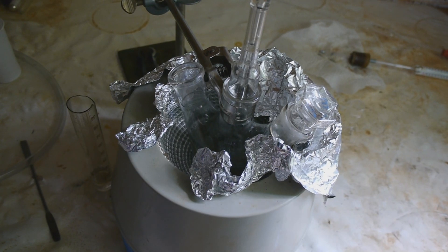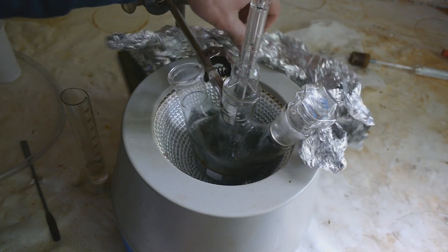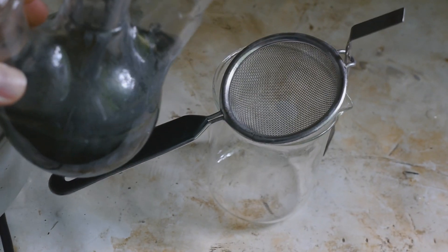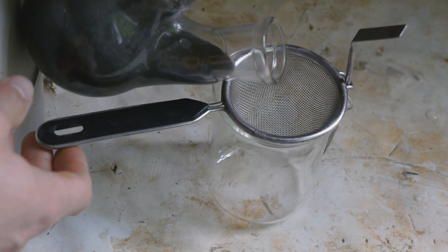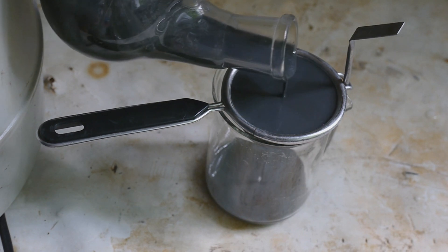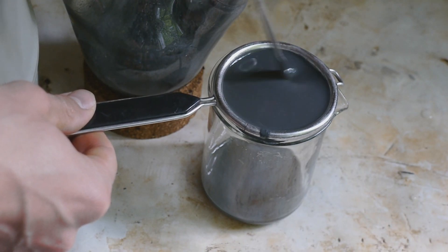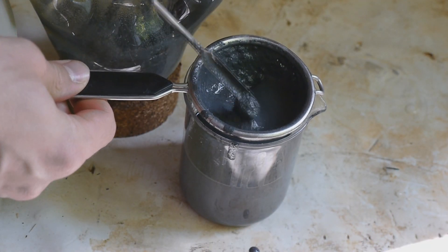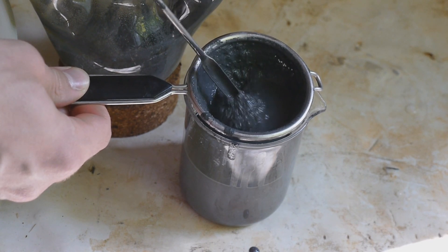Okay I just had a stupid camera failure while dismantling the apparatus. So yeah the oil was cooled down to 40 degrees Celsius. Now I wanted to check if we got any sodium. This entire thing still smells like menthol which is amazing. This is what the flask looks like after the reaction. As you can see you can't really see anything, grey sludge. Let's pour stuff. Oh my gosh, looks like the sodium didn't coalesce again. What am I doing wrong? Let's try to help this along a little bit.